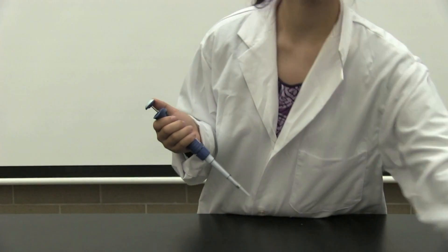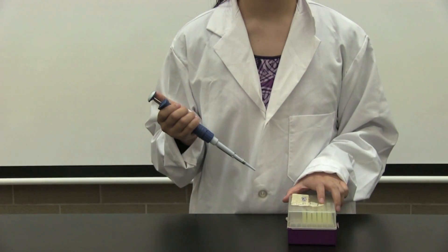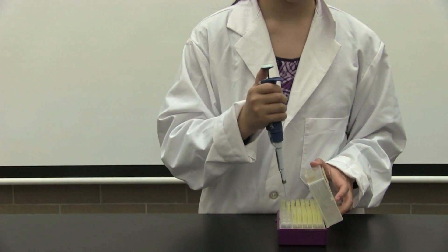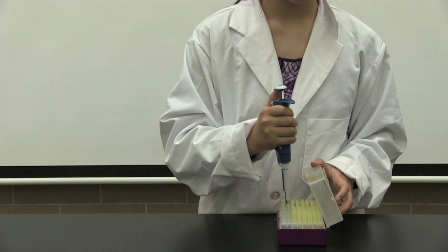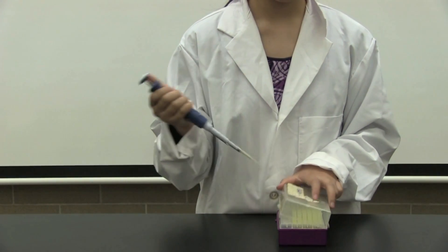Not so fast! We still need micropipette tips! Open the box of micropipette tips, and without touching the tips with your hands, press the shaft of the micropipette firmly into the tip.